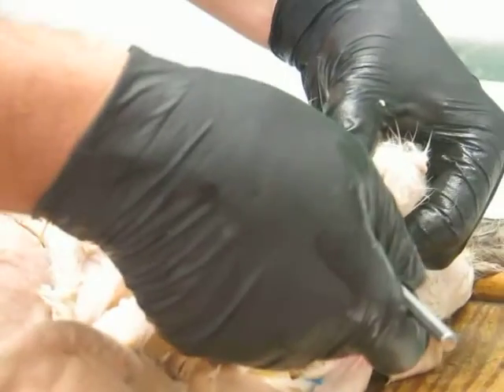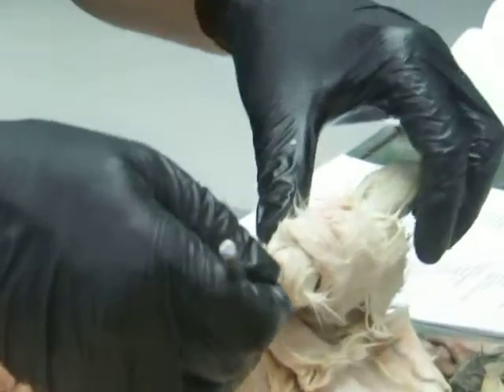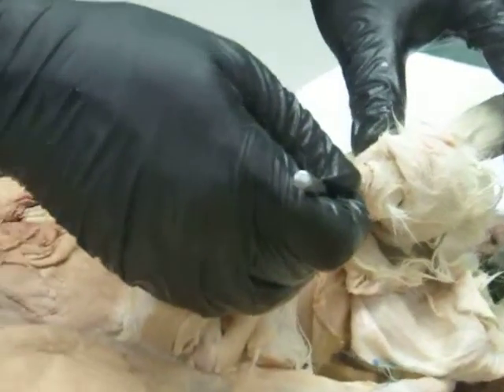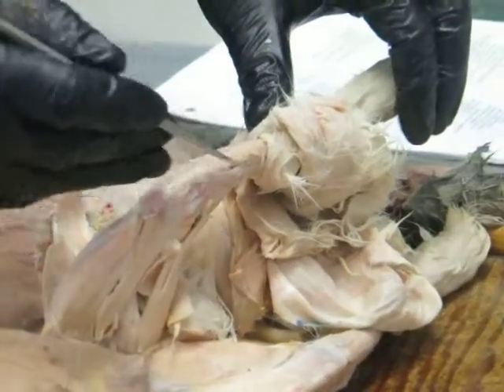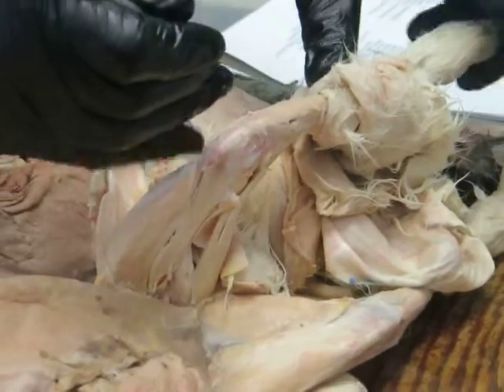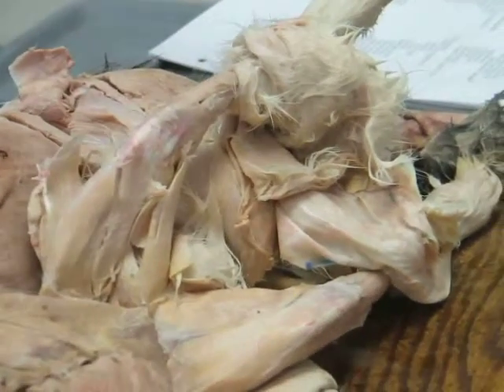It's a big muscle on the front of the shank. That's the muscle that in us, if you go running and you just get those horrible pains in your shin, you get basically shin splints. Those are tears in the connective tissue of that muscle. It's really important. It's kind of a cool thing.